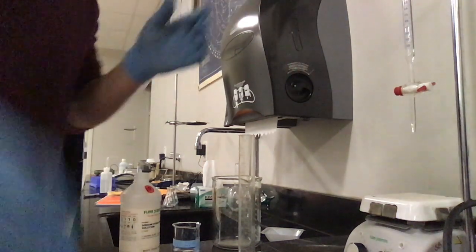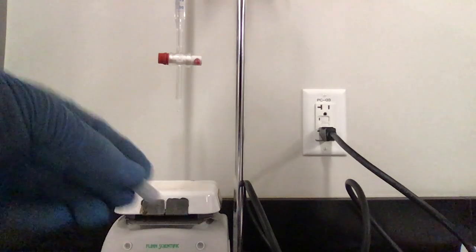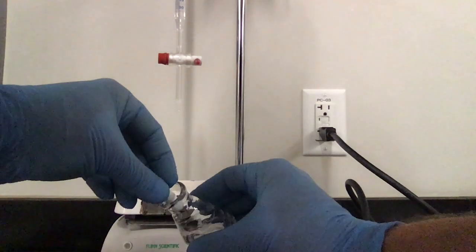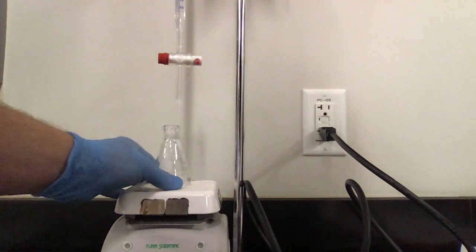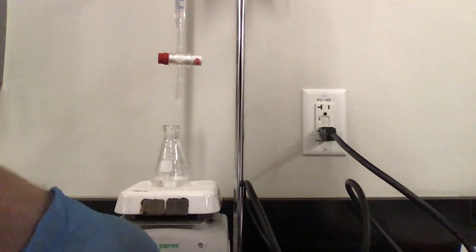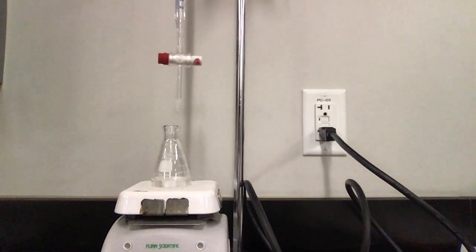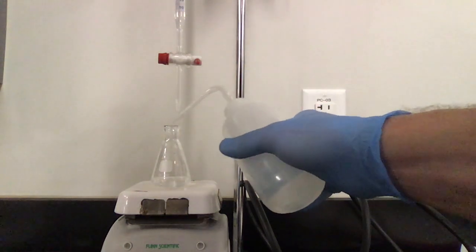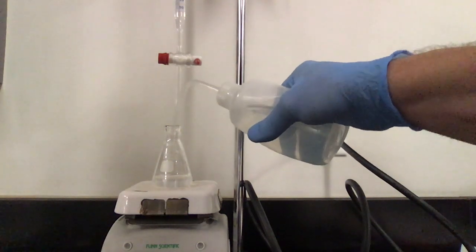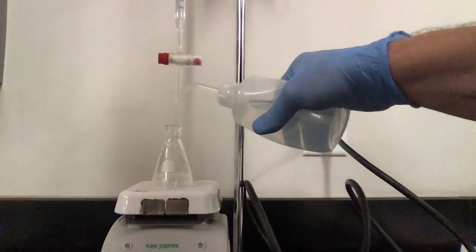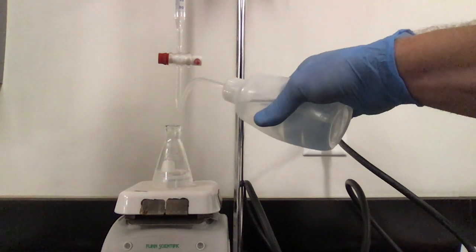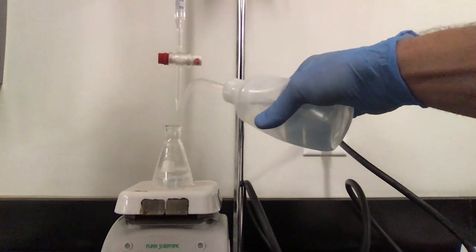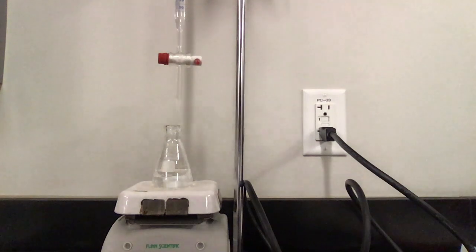I'm going to place it in my burette stand. I'm going to grab that magnetic stir bar. Here is my little magnetic stir bar. I'm just going to place it in my Erlenmeyer flask, trying not to splash that liquid up. I'm going to place that in the middle. You see how that is drawn toward the center. The issue is that the slowest speed on this is still pretty quick. So what I'm going to do is I'm going to spray some water in there and make sure that that stir bar is submerged. That will keep hopefully a bunch of that fluid from splashing out on me.